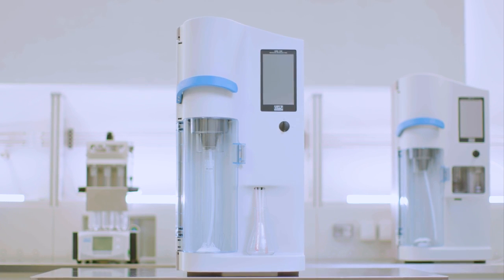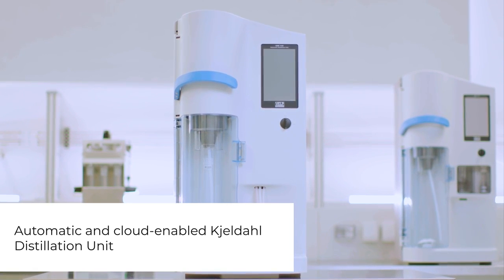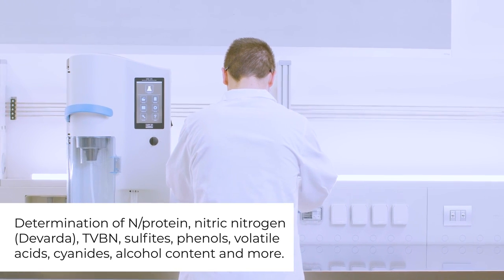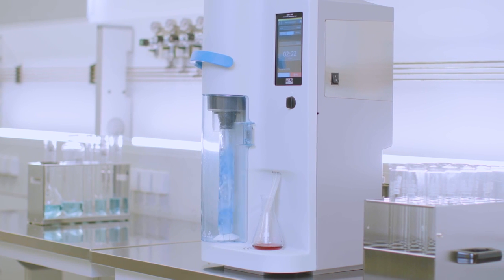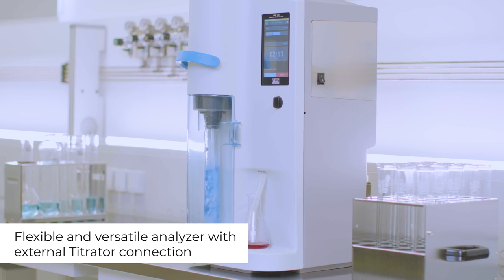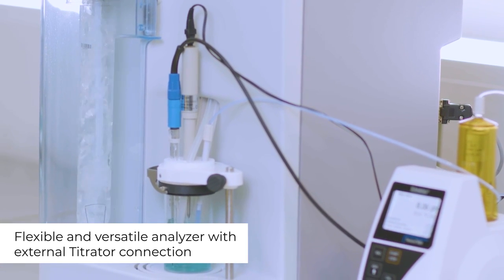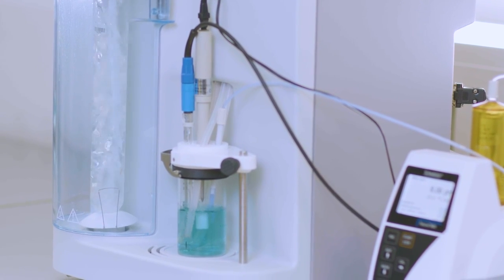UDK 149 is VELP's automatic and cloud-enabled Kjeldahl analyzer for the determination of nitrogen, protein, and volatiles following official methods. The UDK 149 incorporates state-of-the-art technology, offering the highest versatility and flexibility, thanks to the ability to connect to various external titrators for simultaneous distillation and titration.